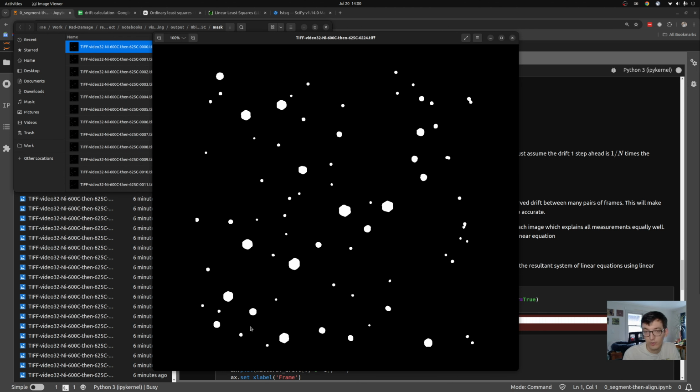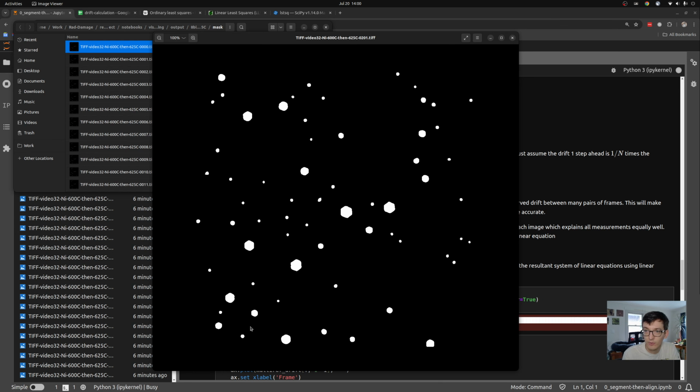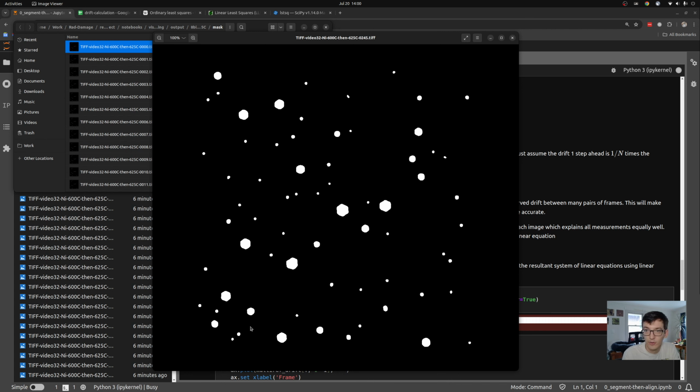The voids do move relative to each other, but what you're seeing mostly in the video is not that movement with respect to each other, but the gradual drift of the microscopy image because it's inside of a microscope, there's thermal swelling, the beam drifts, and all of these other factors complicate us from being able to see what's going on with the individual voids in their movement, and thereby allowing us to understand how materials change at the atomic scale better.